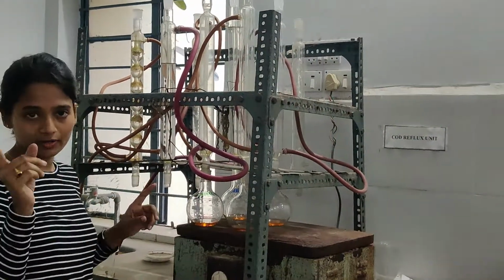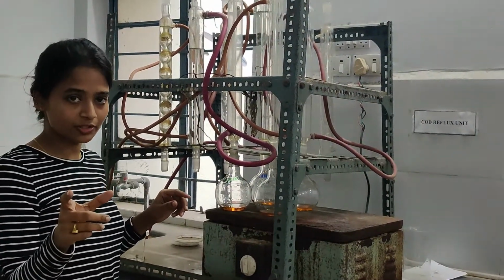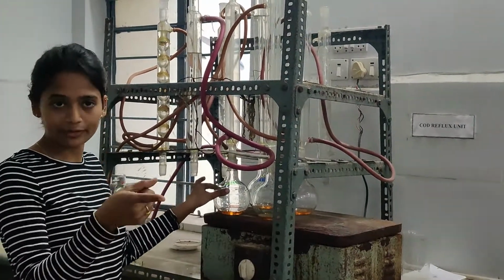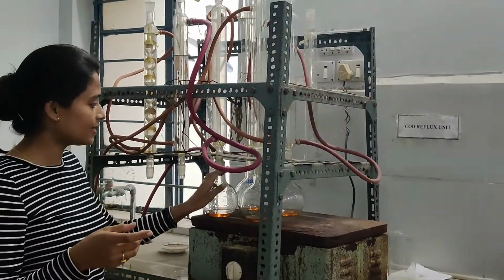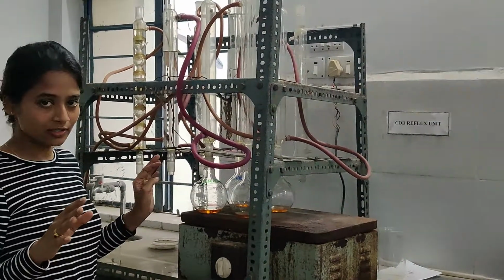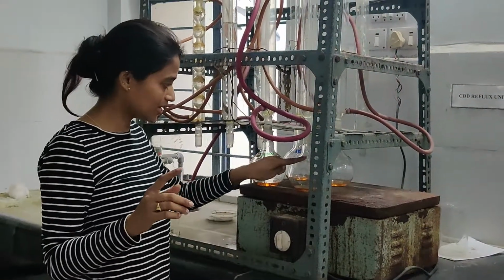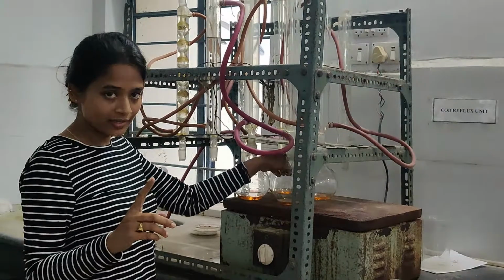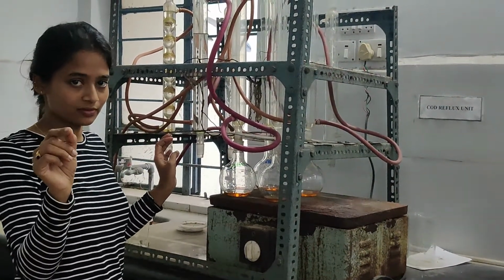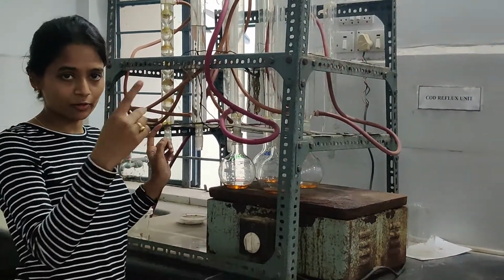Then you will be using just 5 and 3. In the procedure, you have the formula for COD calculation, right? The blank's reading you will get by doing the titration, and you will get readings for 3 and for 5. You will calculate the COD of the 3 ml, the COD of the 5 ml, and the COD of the blank separately. You need to deduct that blank from the sample one. I will explain that on the board.